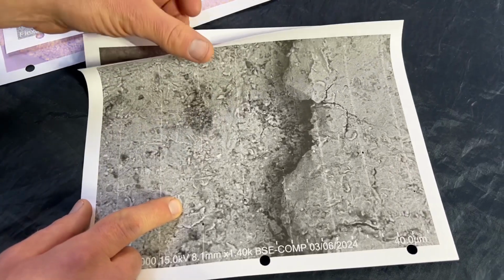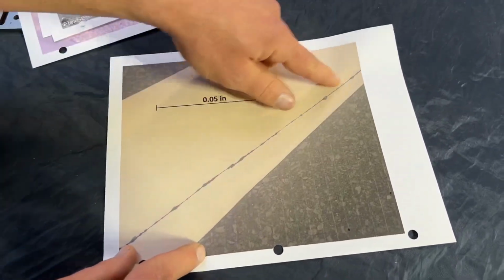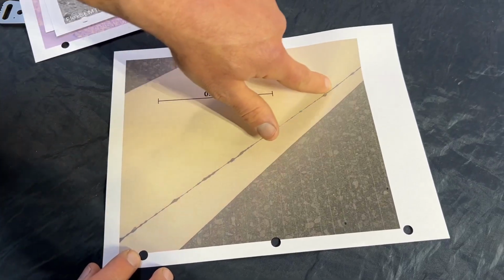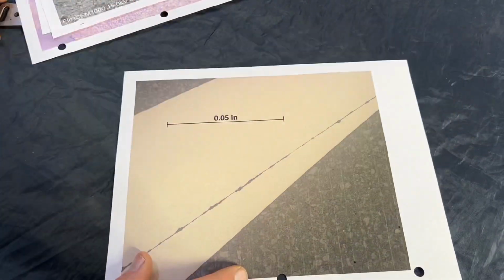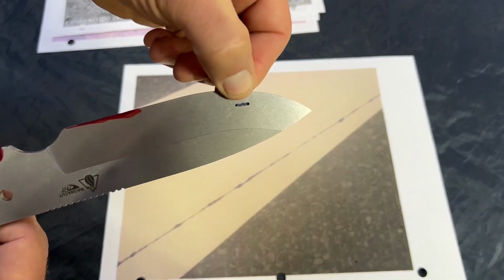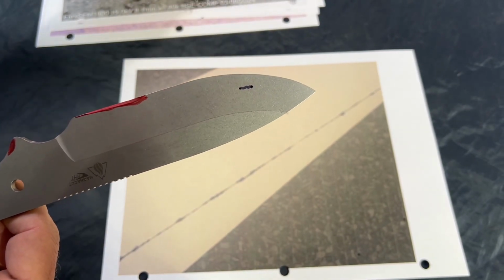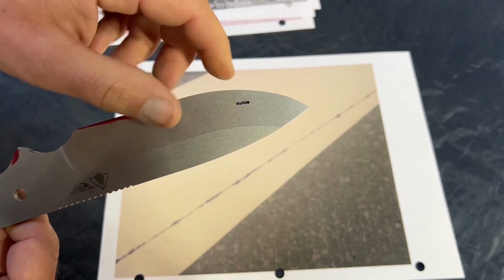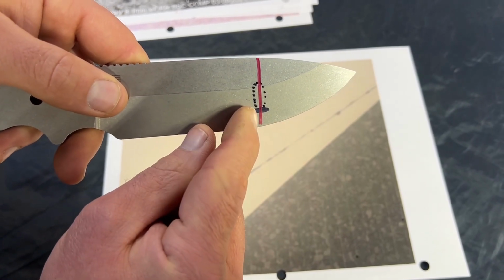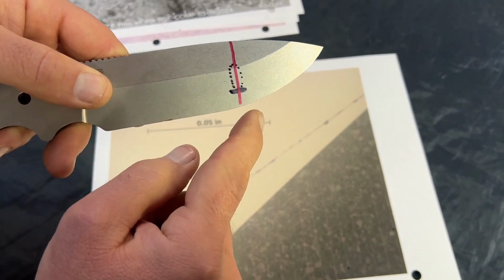After I made that original video, we got a follow-up photo from the lab here where they cut into a part. And I just want to explain what we're looking at here, because all this ragged edge here is just kind of sandwiched into the material. So what happened here is with these early images, we were looking at the surface right around the anomaly and in that region on the surface. After completing their investigation of that area, just to see what that was looking like, what they did was bisected that where it was visible and cut it in half, which we knew there was probably going to be a longer anomaly in there just based on previous observations on the surface grinder.